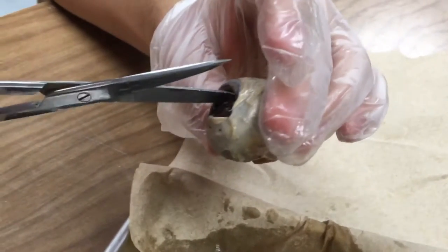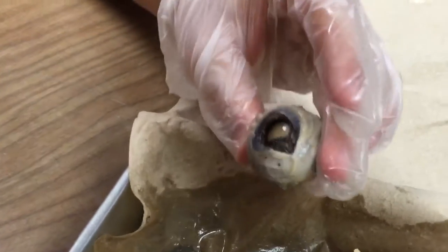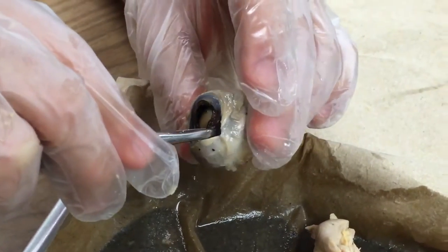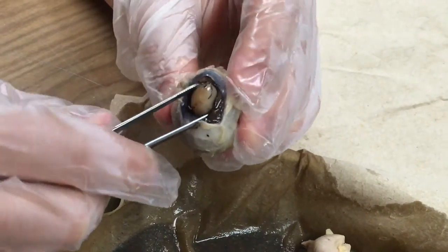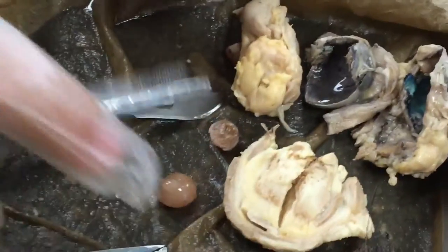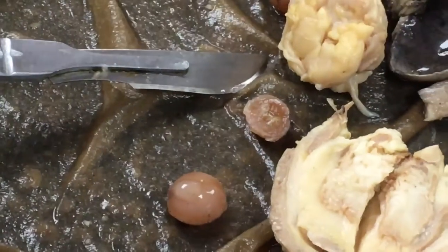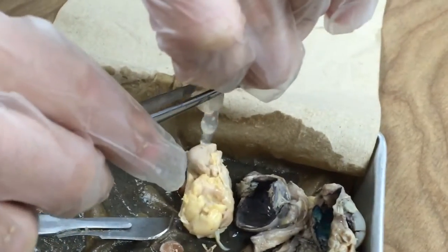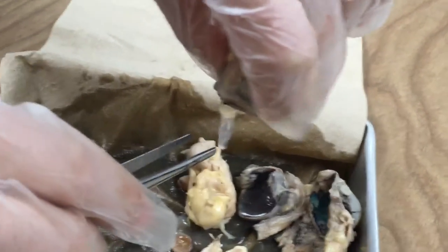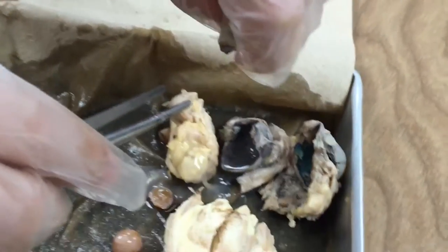Or use the forceps. Yeah, use the forceps to get that out. Like this. Oh yeah, yeah. Is that one better preserved? There we go, just go for it. Oh. It's like my language. Ew.